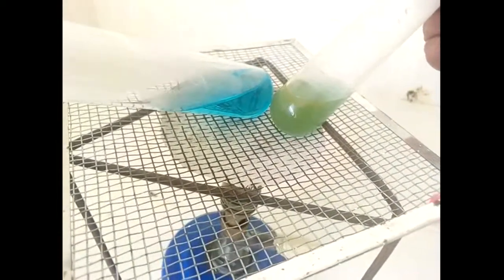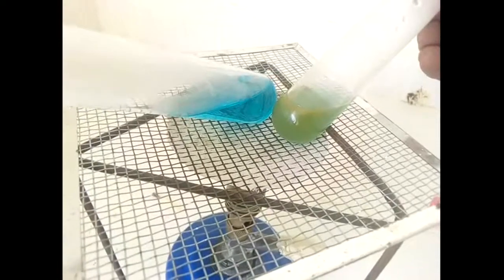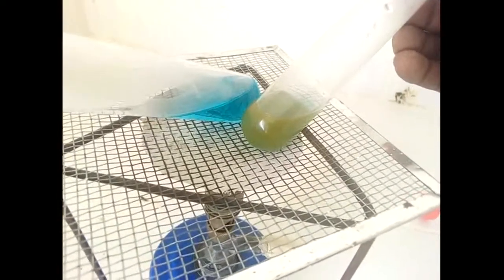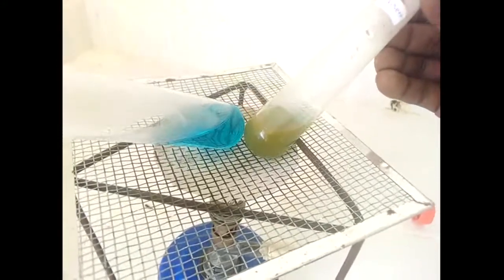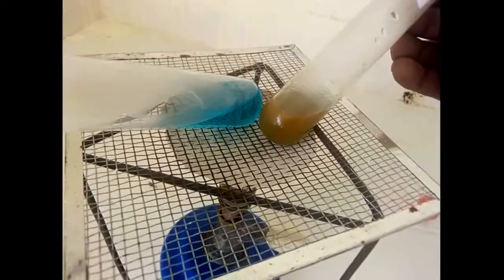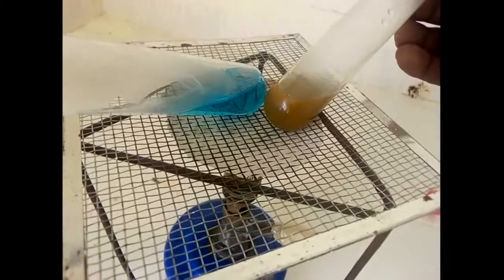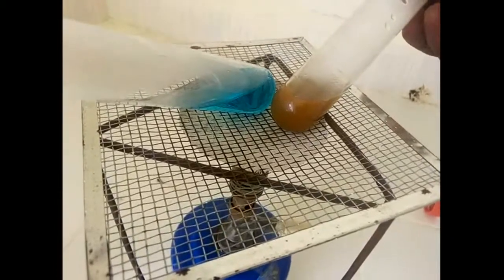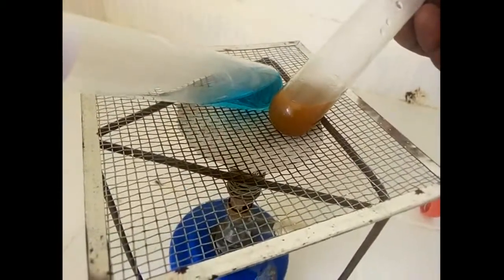It is between green and yellow, and the change is still taking place for the positive one, the one that I'm holding with my right hand. As you continue looking at it at very close range, you'll realize that the color is now changing to orange, especially the superficial part, and now it's changing to brown, which marks the climax in the changing of this color.